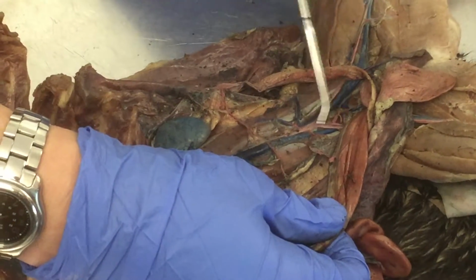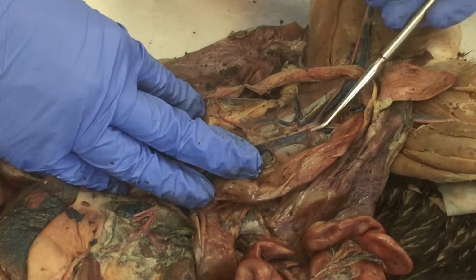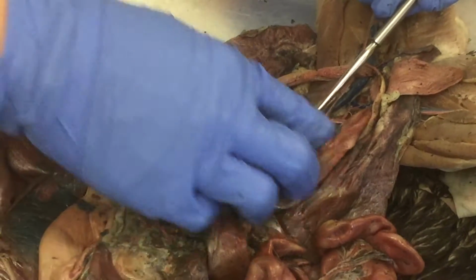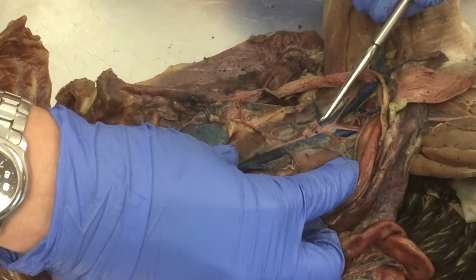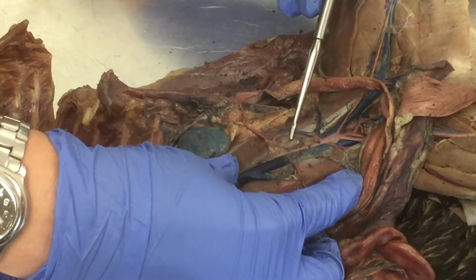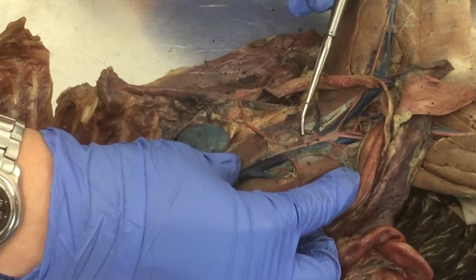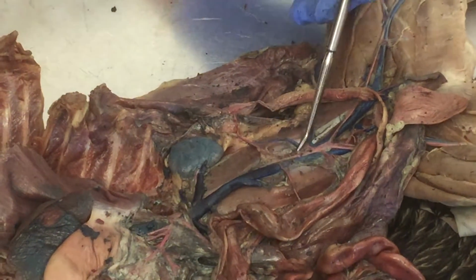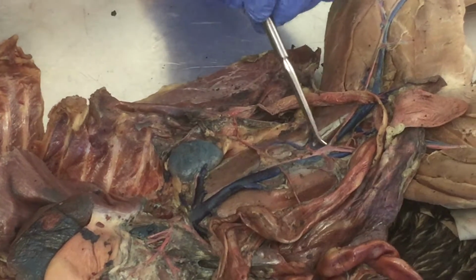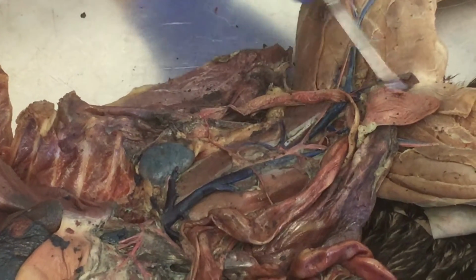And then right before you see the fork in the road are your deep iliac circumflex, which feed the muscles of the low back. So right and left, artery and vein combo. This branching up here, this is kind of an anomaly. I don't quite know where that's going, so that's not very typical. Okay, and then we get into the leg.